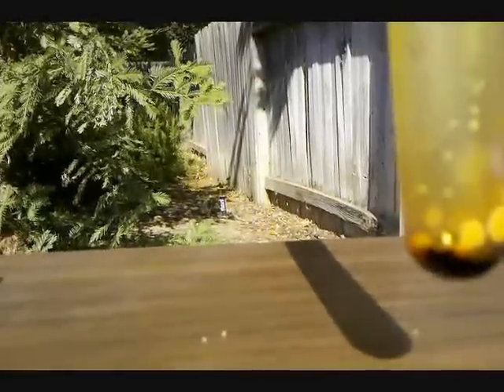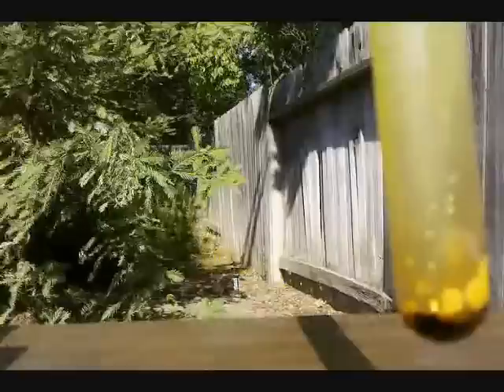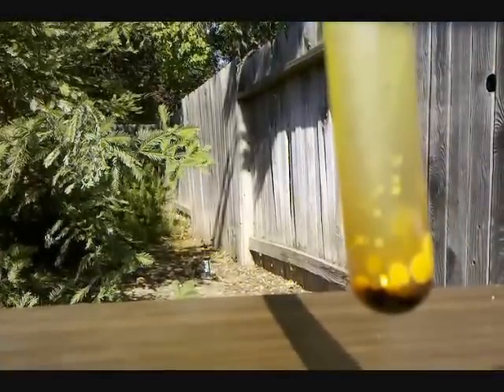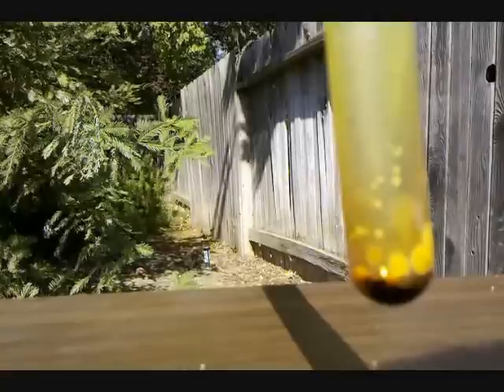Anyway, so there we have pure liquid iodine monochloride.